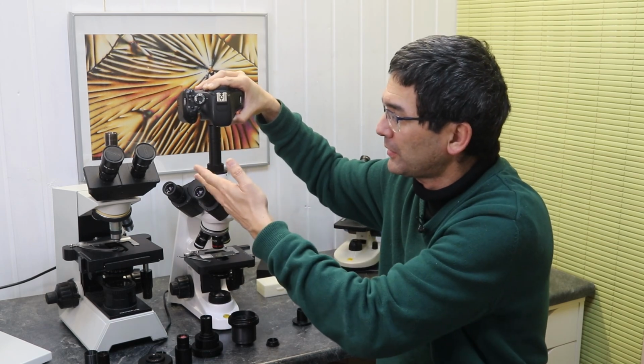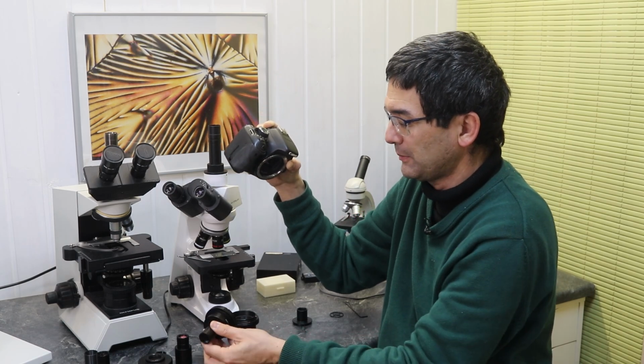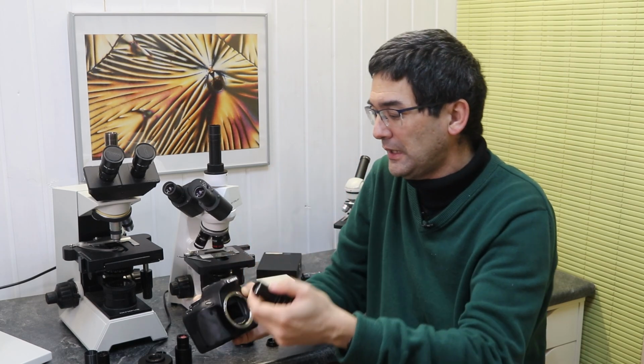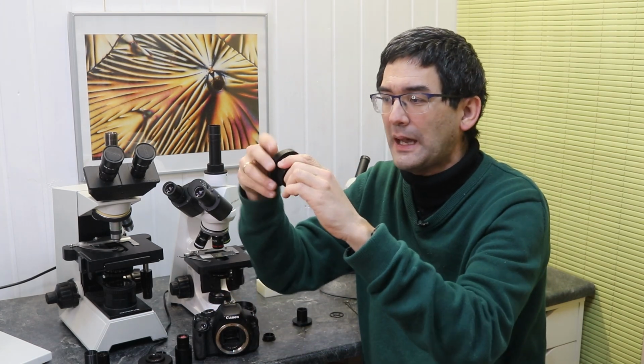But that's the problem now. What am I going to do? Okay, so there is a solution here, and it is possible to buy those DSLR camera adapters like those, and they have optics in front, and on the other end over here there is a so-called T2 adapter ring, which is camera specific. So for Nikon and for Canon, they have different T2 adapter rings, and for the mirrorless cameras, which are now starting to appear on the market, you've got to check that there is also a T2 adapter ring. They're actually much thicker, those for the mirrorless cameras.